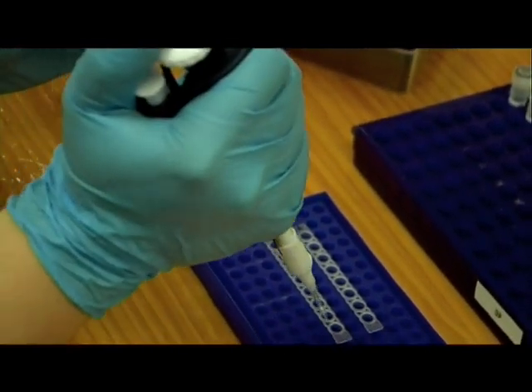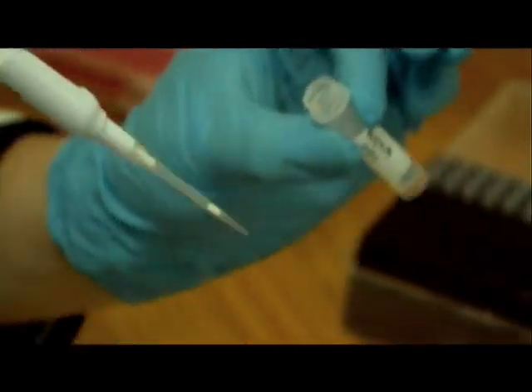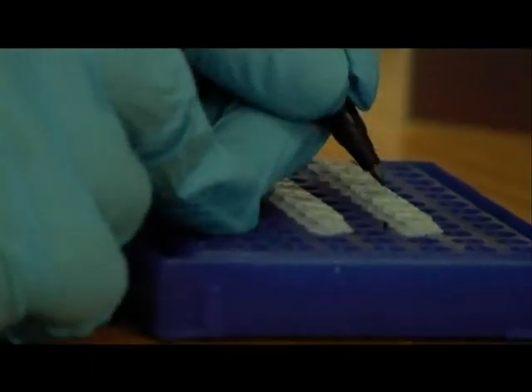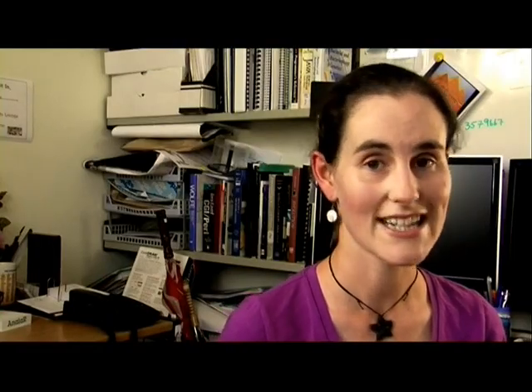Lastly, the weka DNA is added to each tube. Here we are testing six birds, so each PCR has seven tubes. The last one is the negative control, and contains all of the reagents, but no weka DNA. PCR is such a sensitive technique that it can amplify from just a single DNA molecule, so we must be sure that what we are amplifying is our weka DNA, and not a contaminant.